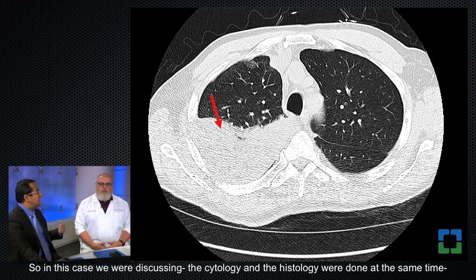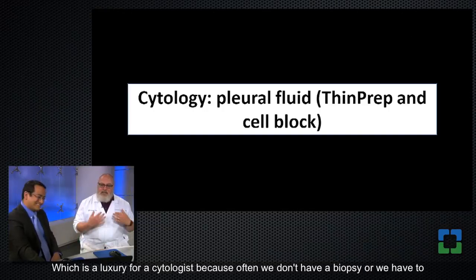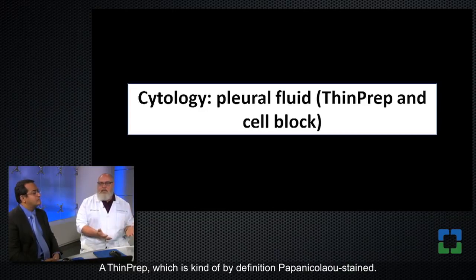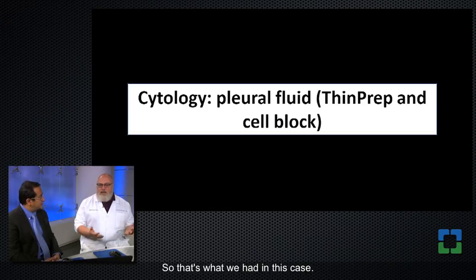So in this case, we were discussing the cytology and the histology were done at the same time, so we had the chance to look at both together. Which is a luxury for the cytologist, because often we don't have a biopsy or we have to wait a week or two to get a confirmation. Right. So here at the Cleveland Clinic, we process our serous effusion cytologies as two slides. A thin prep, which is by definition Papanicolaou stained, and then we make a cell block from any sample that has enough cellularity to allow that. So that's what we had in this case.